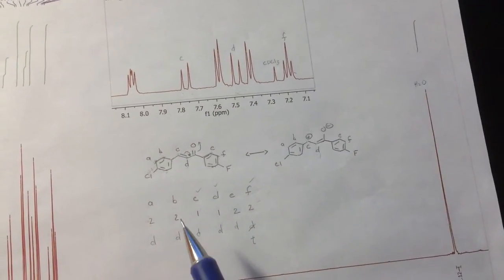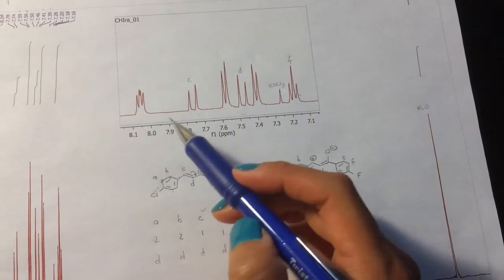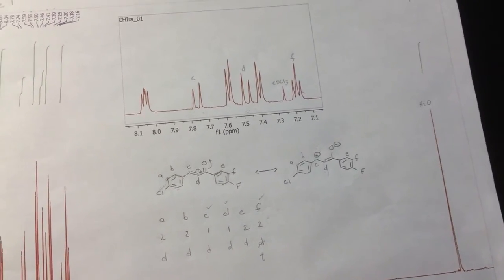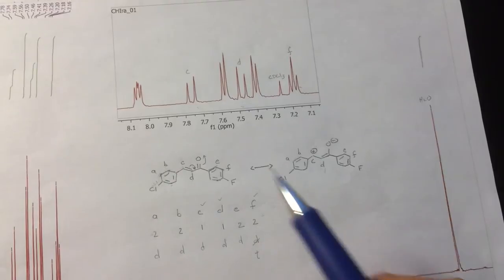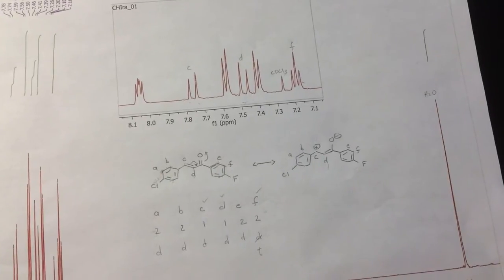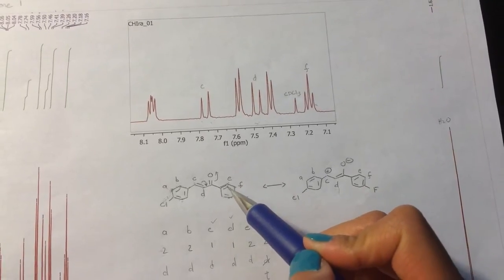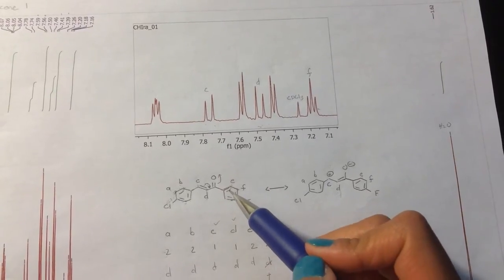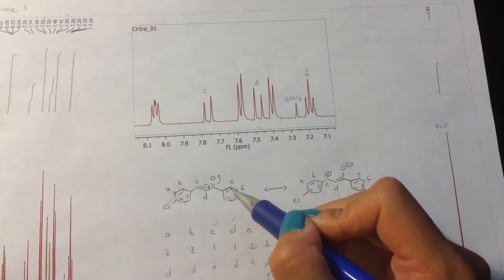And so what we have left are A, B, and E. The next one that you might want to try and assign is whatever is furthest downfield. Things that cause peaks to go downfield are basically anything that makes it de-shielded. Substituents that are electronegative will do that. As we saw here, resonance structures that allow positive charges to be created will also do it. And one other resonance structure that I didn't mention in class is the possibility for these electrons here going into here to also make that enolate. And what that would do is put that positive charge on this carbon here.